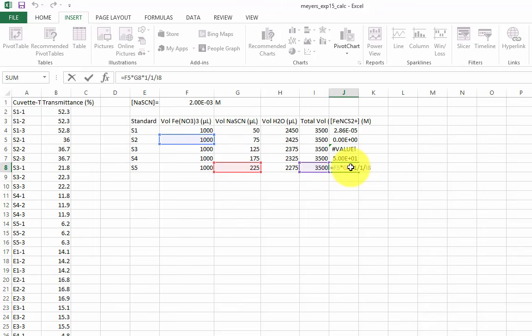First, click Escape to get out of the cell editor. On the first cell, I'll edit the equation so that it holds the F1 cell reference constant. Do this by pushing F4 on your keyboard, or by typing the dollar symbol before the column and/or the row. Now when the equation is carried down, the F1 cell is still referenced.